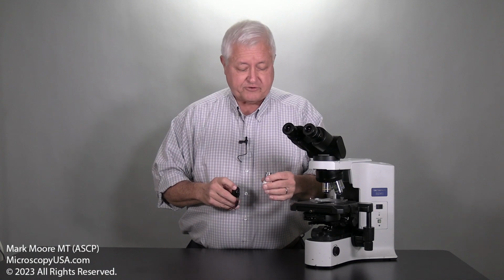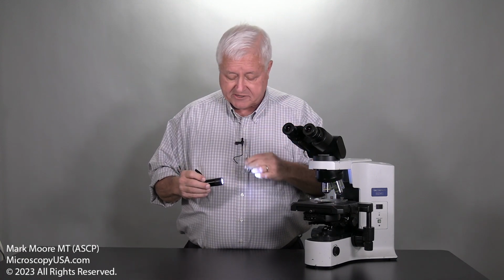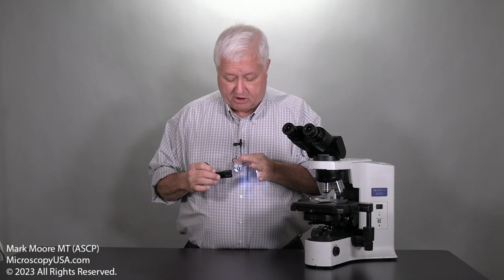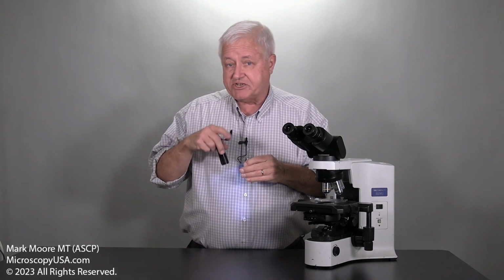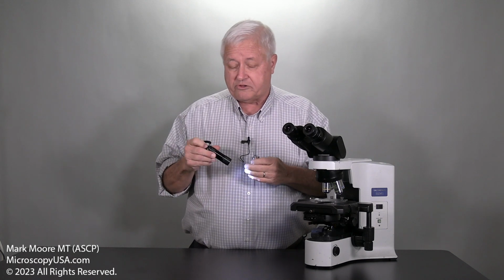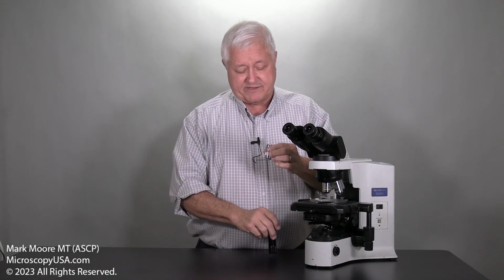So this is how you determine whether it's bad or not. One is simply to turn the lights out in the room, get yourself a flashlight, a little pen light, and look down into the objective after your eyes have adjusted to the darkness. Hold the light directly across the bottom of the objective. If you look down in, you can usually see the film of oil that's inside the objective. That's bad. There should not be any oil inside the objective.